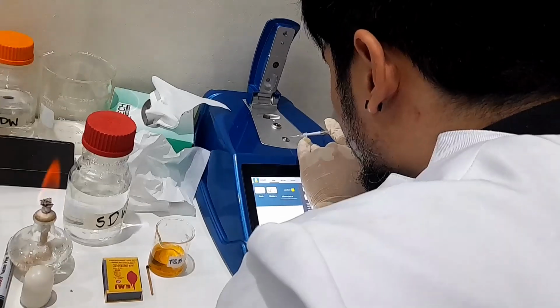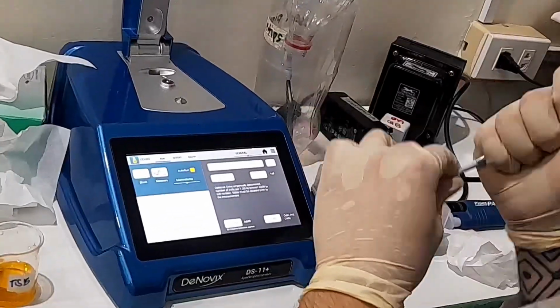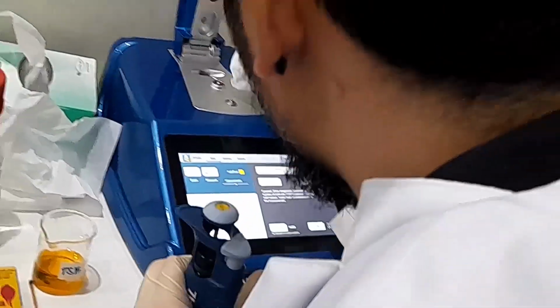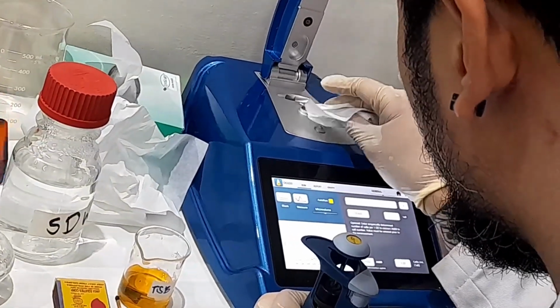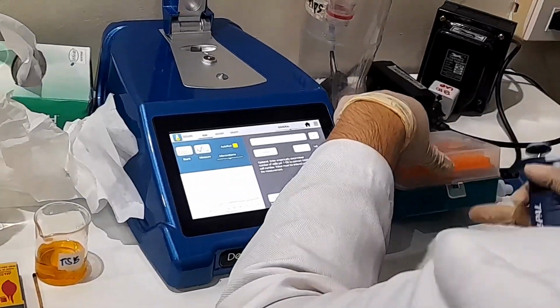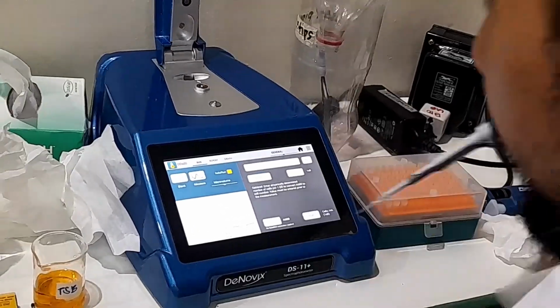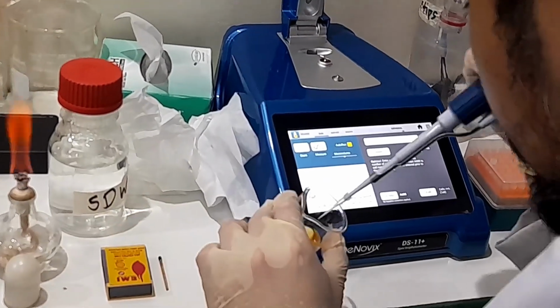Tips. And the reason for that is because I'm just cleaning. If I'm cleaning, oh, this one's stuck, isn't it? And again, I'm not really going to flame for this one. This is just trash when we're done with it because we're not using it for anything. I'll flame when I want stuff to remain sterile, and that's going to be for the solution.